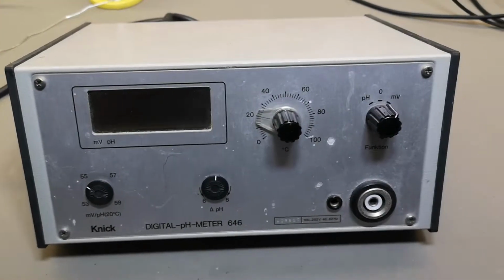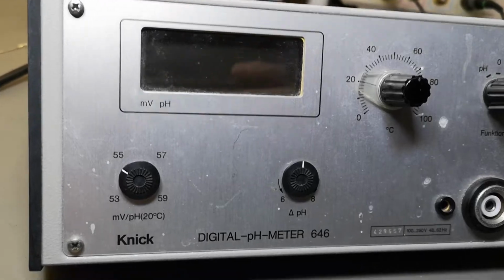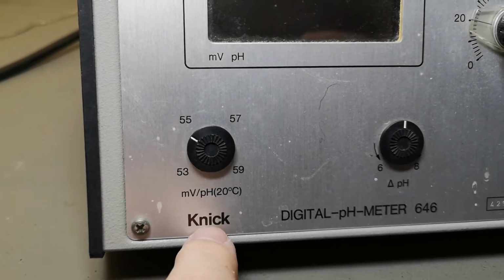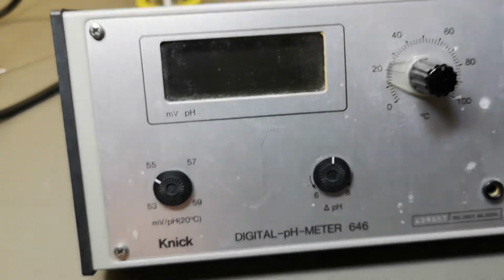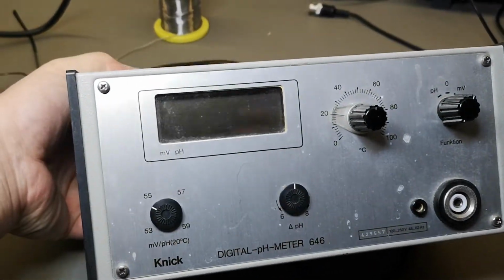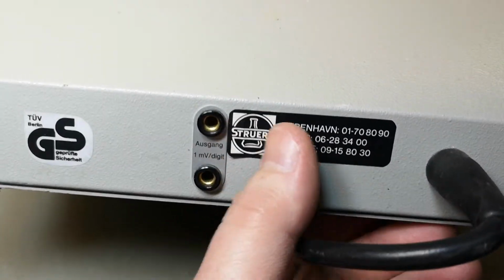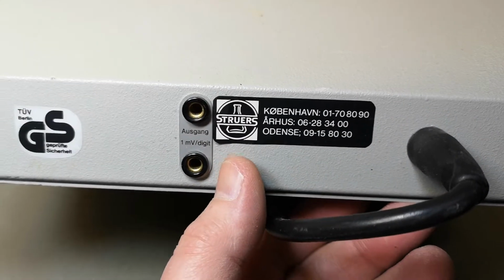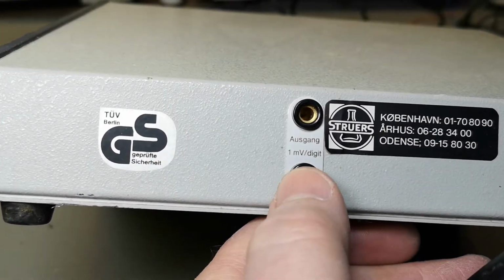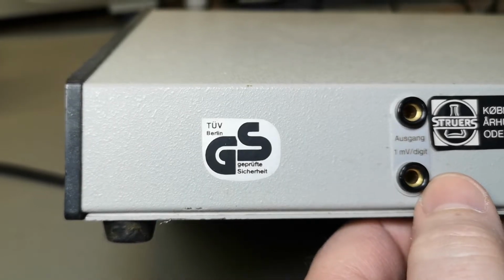Welcome to another teardown video. This time it's a digital pH meter 646 from Knick. I think this is a German brand, right? This is like lab equipment for either schools or research. It's sold by Struers, and those guys are selling lab equipment and school equipment for all sorts of science labs. And this reveals that it's made in Germany, the Ausgang, and of course this one.